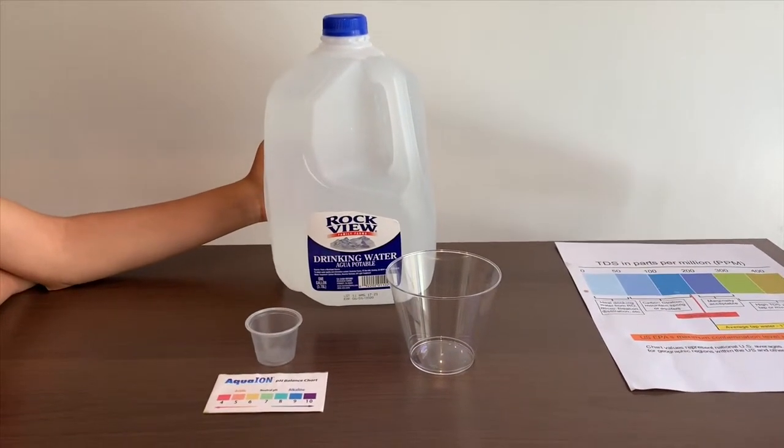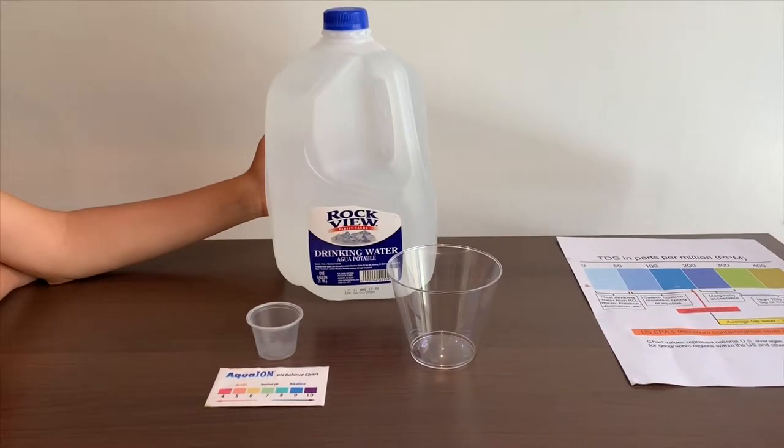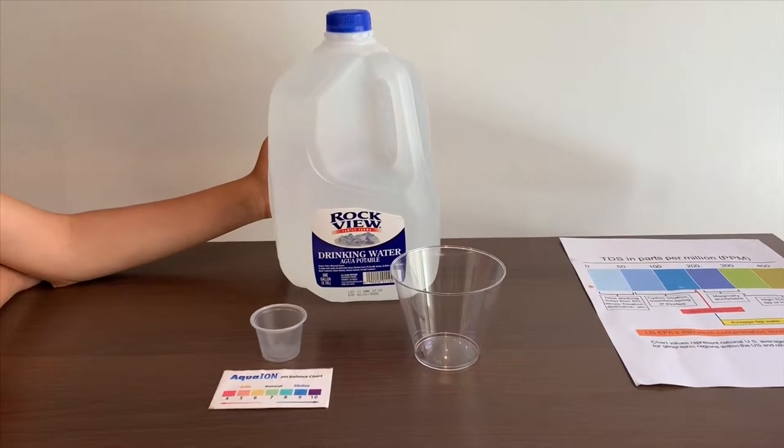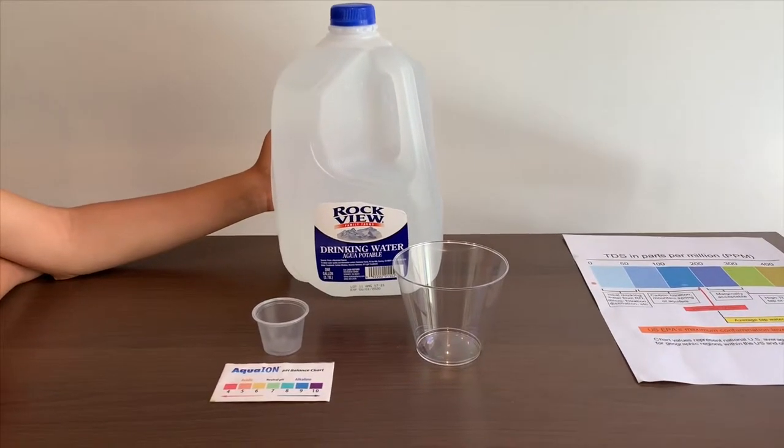This is Rockview Purified Drinking Water. It's sourced from California and costs $2.50. Let's test the pH and TDS levels.